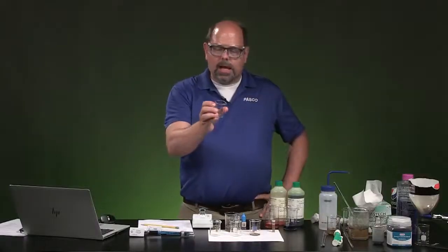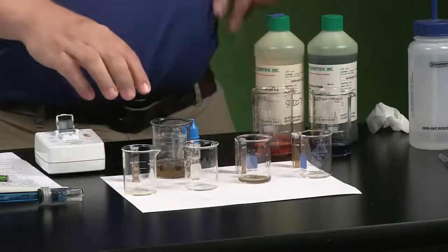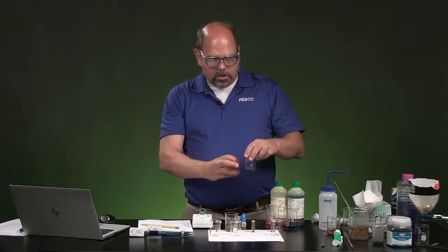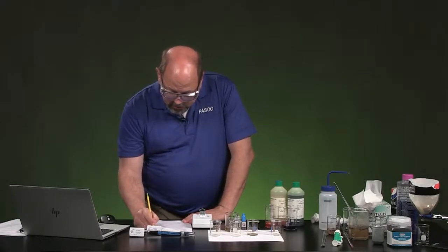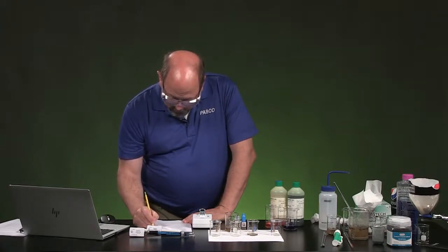And then this one just sat and sedimented. And that one's very strong. So these guys that didn't do chemical, the charcoal is probably the least of these, but they all still smell like coffee. So I'll just put those in. Coffee, smell, coffee, smell. Coffee. And the only difference was that the charcoal had a faint coffee smell. So I'll just mention that.